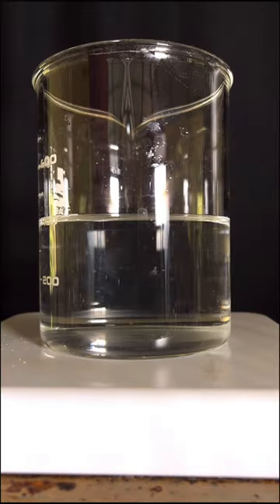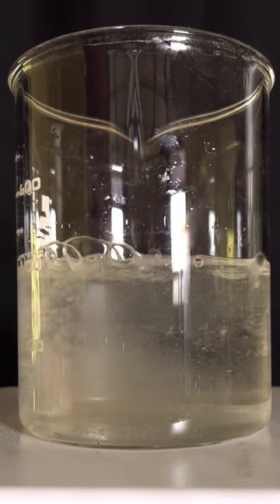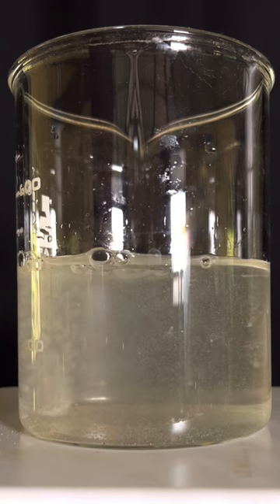We have taken a beaker with water and I dropped a chunk of this rock-like thing. Immediately you see a vigorous reaction taking place, producing lots of bubbles. It is also an exothermic reaction.